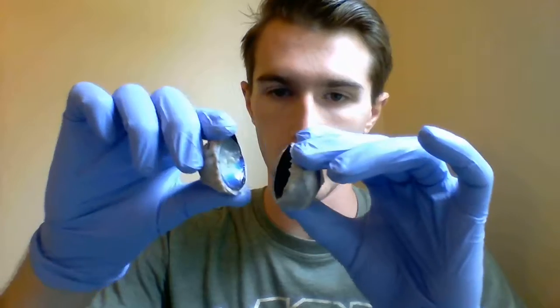The posterior part of the eye shows the posterior cavity, which is contained in this space here. The posterior cavity contains the vitreous humor, which is a thicker, more viscous substance than the aqueous humor.